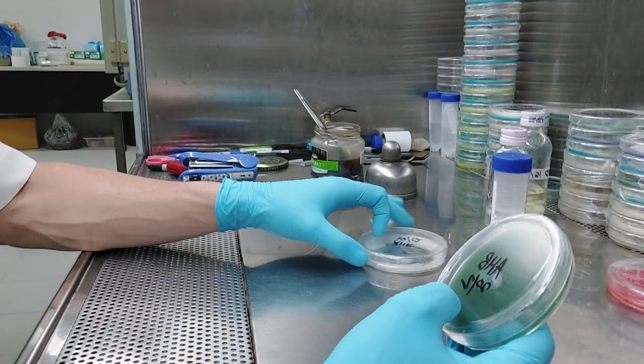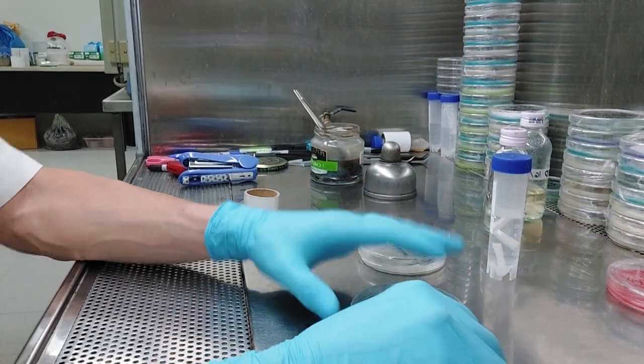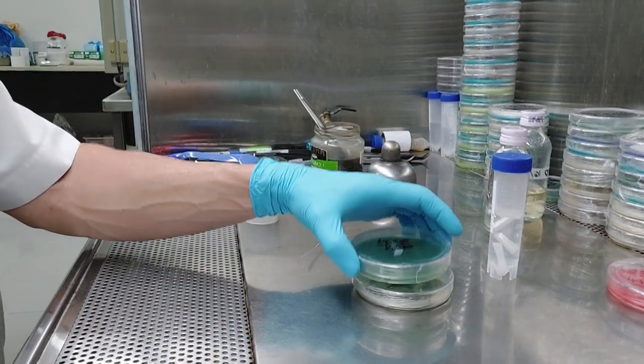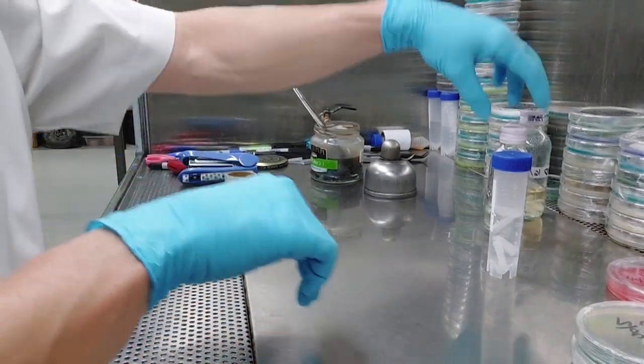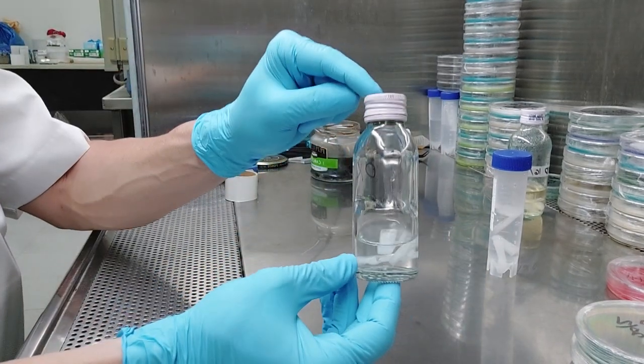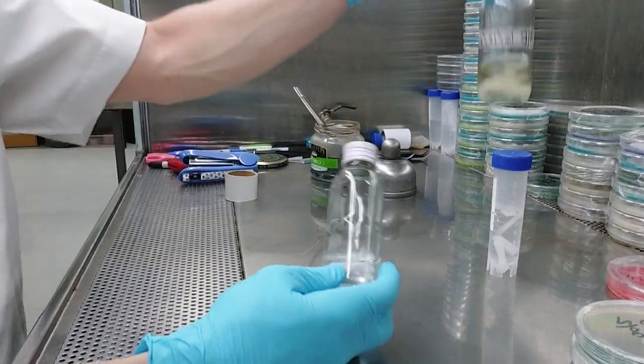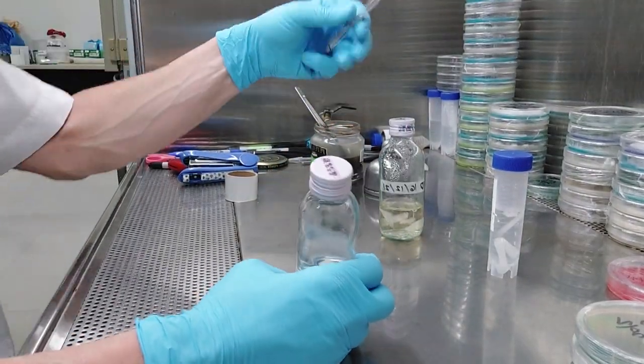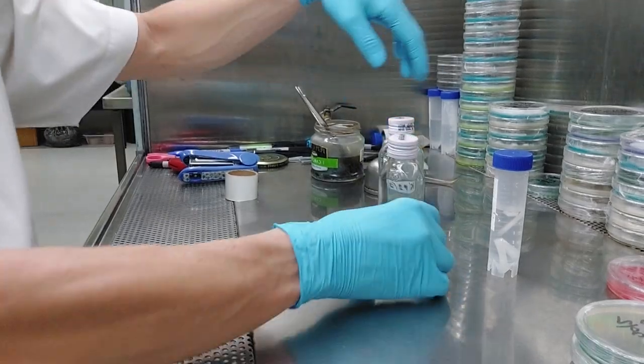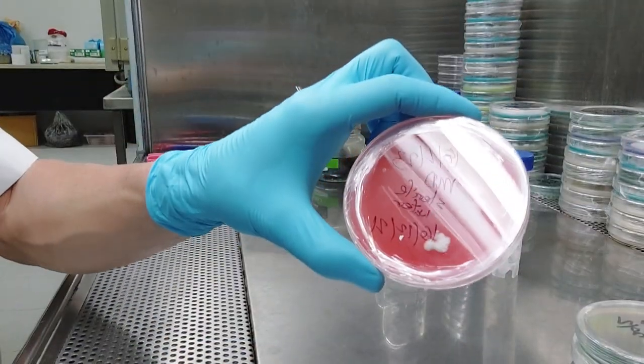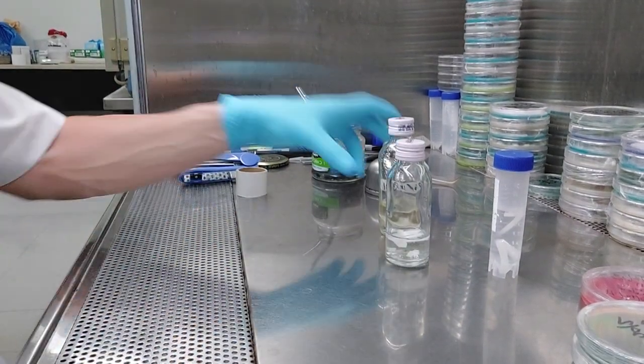They like to know what you're doing in the residential neighborhoods. Again, so that's it pretty much, you guys. So we have long-term water storage in glass. You can get these anywhere. It could be a whole freaking quart jar if you wanted to do that. Problem is it's going to be hard. So when I pulled this out, I basically got my handy dandy tweezers here. All right, back to the tweezers. Got in there, got it a little bit sideways, pulled out a piece, put it on my agar, let it dry out for 10 minutes or so, wrapped it up. There you go. Bam. Two-year-old culture. Didn't have to sub it. Didn't have to do anything. It's all good to go. So that was that.